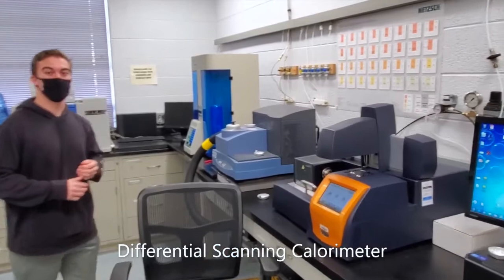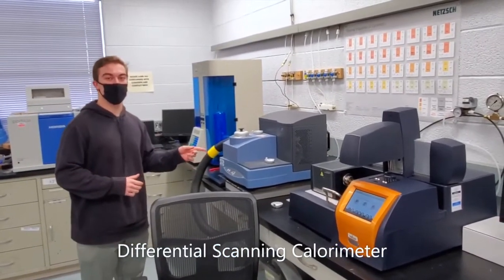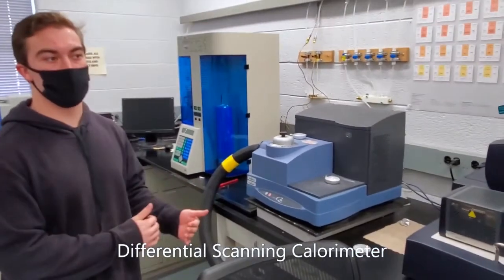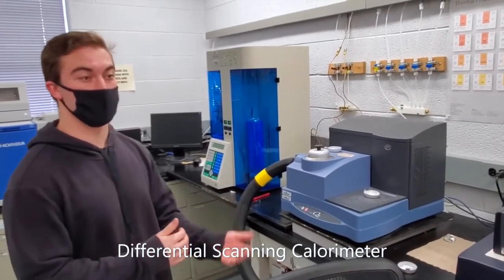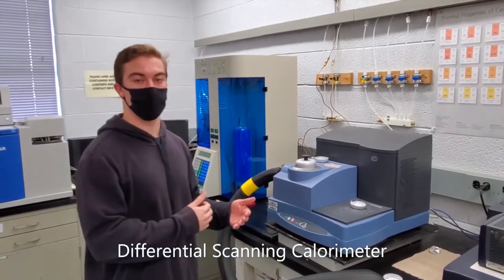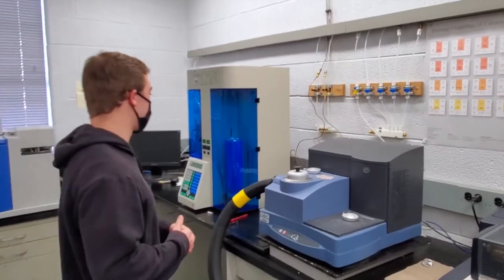Moving on to the next device here, we have DSC, differential scanning calorimeter. So this kind of tells us the crystal temperature and how the structure of the material is and how it reacts to cooling and heating within the crystal structure and its phase transformations.